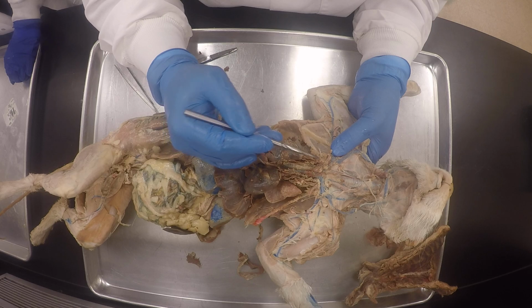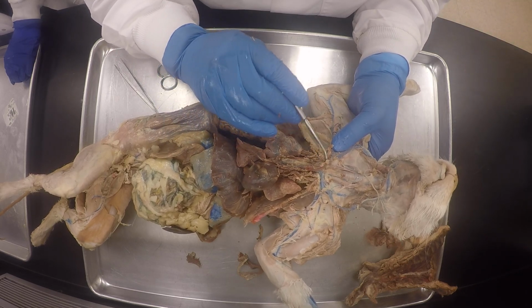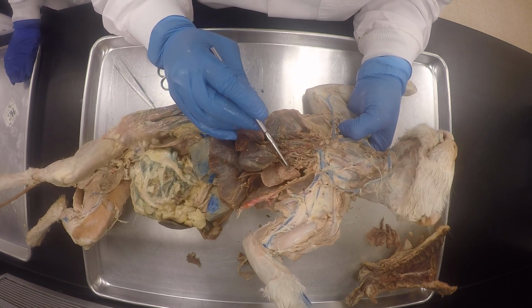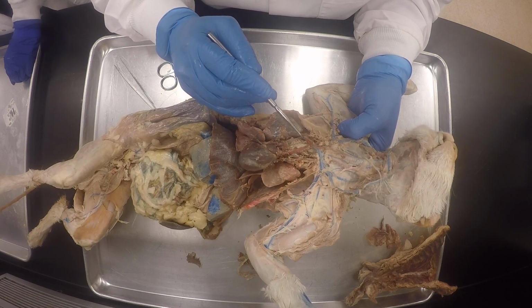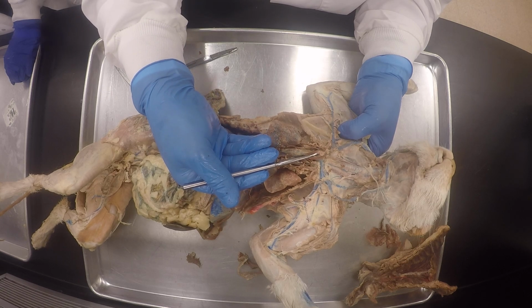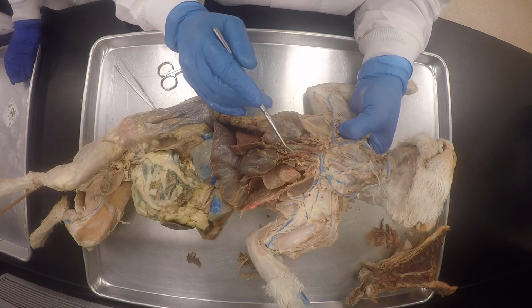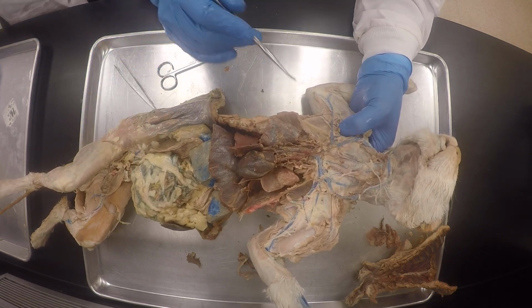Remember I was saying it looks like breast, nipples. You see what I'm saying? So it just needs a little cleaning. So this is the right subclavian artery. This is the left subclavian artery, brachiocephalic trunk. And then the brachiocephalic trunk gives rise to the common carotid on the right and then the common carotid on the left. But they're branching from this brachiocephalic, so they're just common carotid.